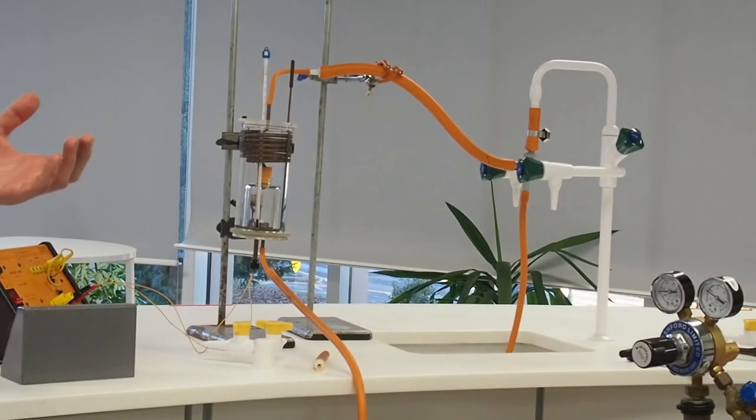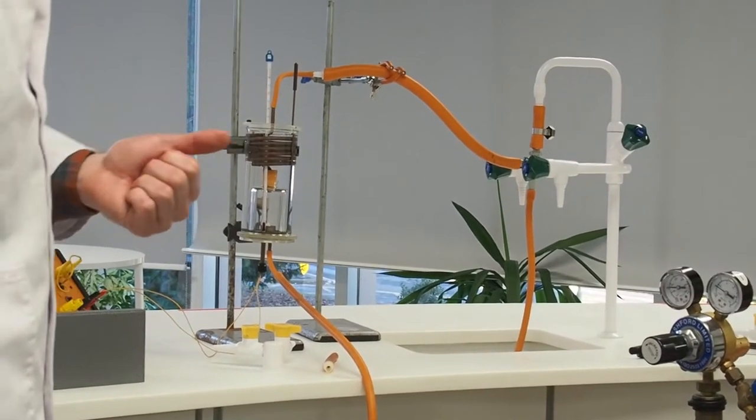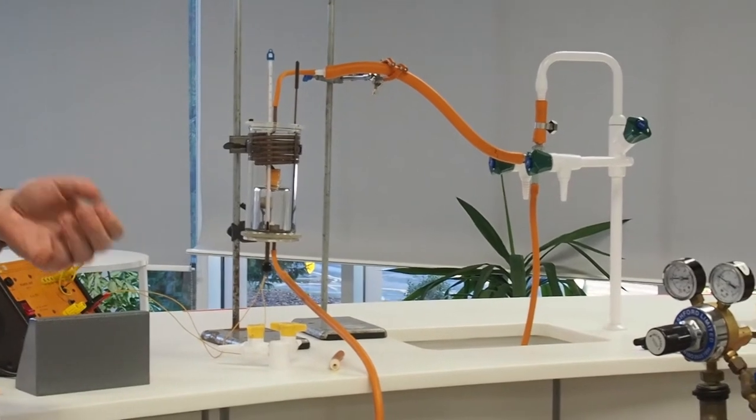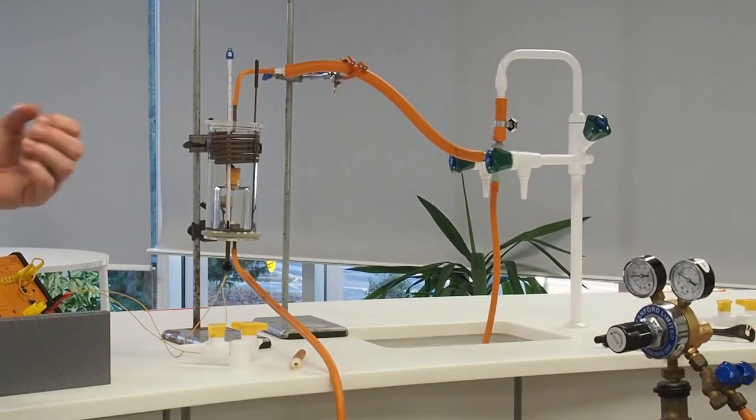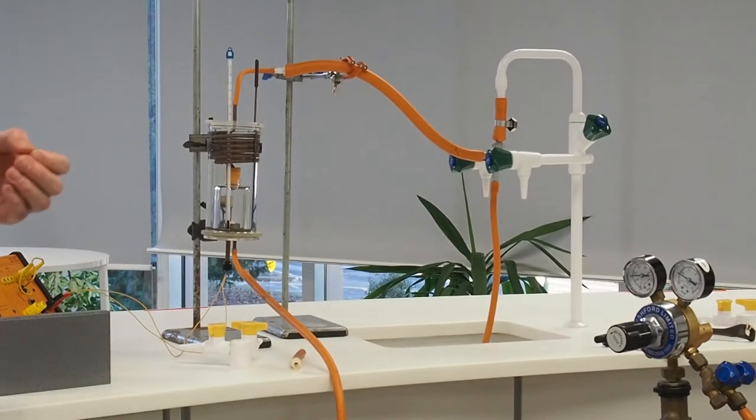Before I start the experiment I need to know a number of things. I need to know the volume of water. The volume of water is 618.26 grams. I'll put this on the board for you in a minute.